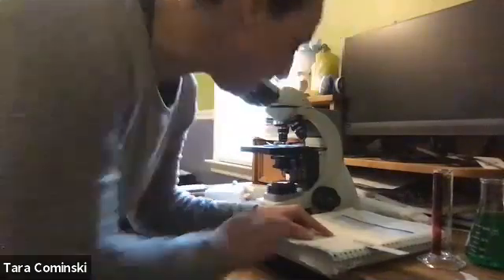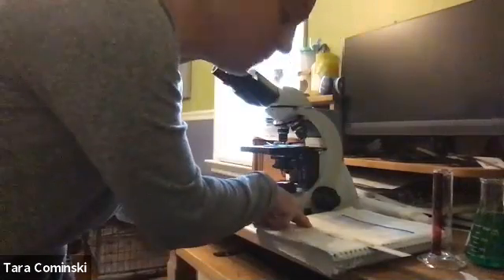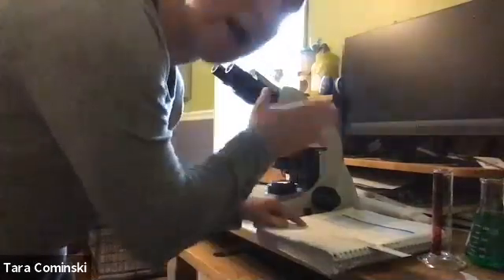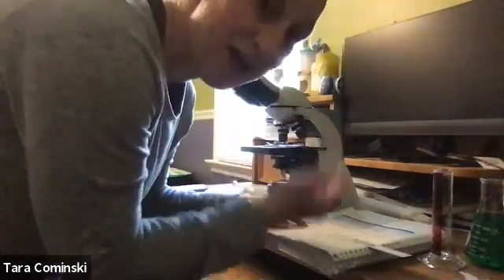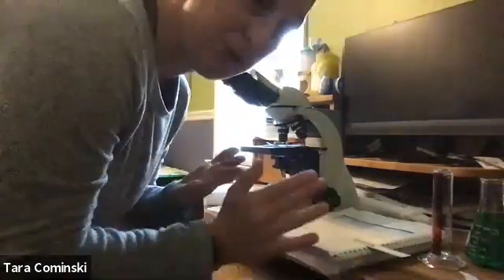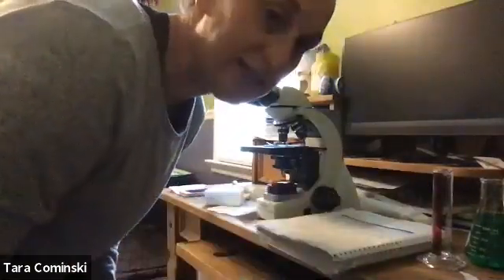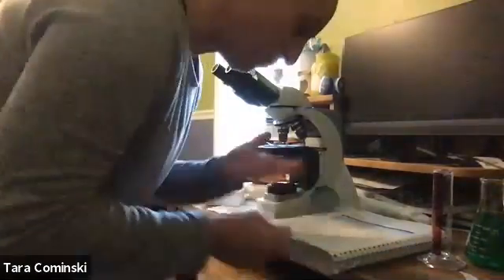That is what you put in the first slot where it says MM. Then it asks you to convert it into micrometers, and then into nanometers. You need to do those conversions and fill them in. The only thing you need from me is that measurement, 37 millimeters. And it gives you an example of how to convert.